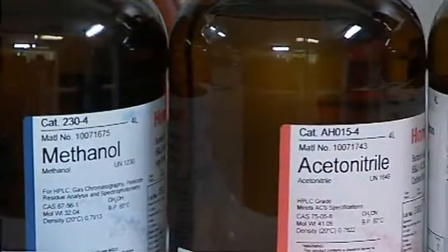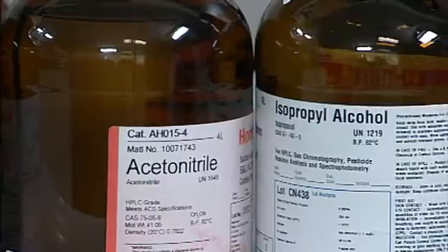Okay, so now you've done methanol, acetonitrile, and 75% acetonitrile with 25% IPA. What's next? Well, if that hasn't solved the problem, then I'd convert to 100% IPA. Many times, that series of solvents will take care of the problem. If it's something that's very, very nonpolar that's clogging your column, then there are 2 other solvents that might be used as a last resort.